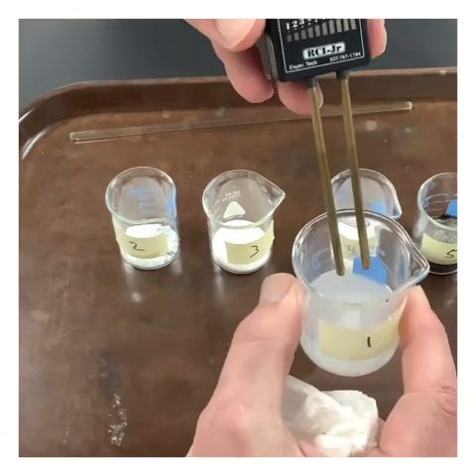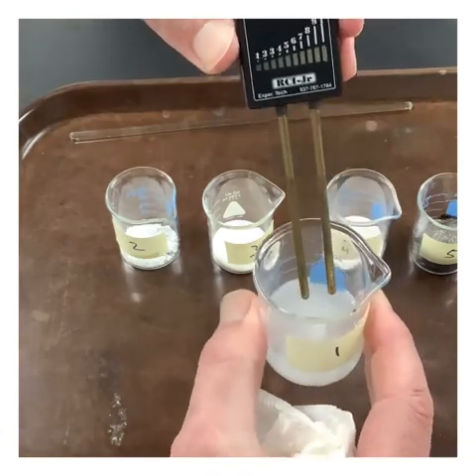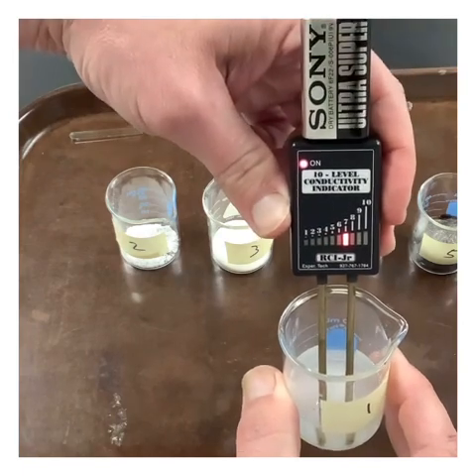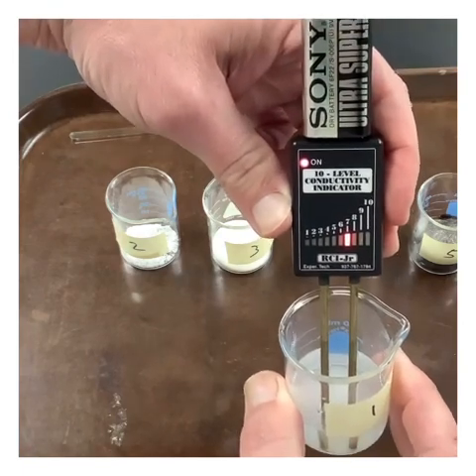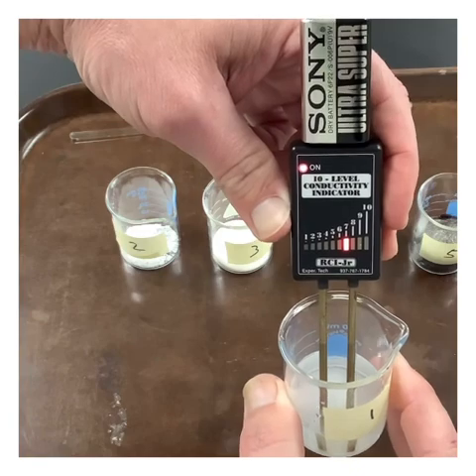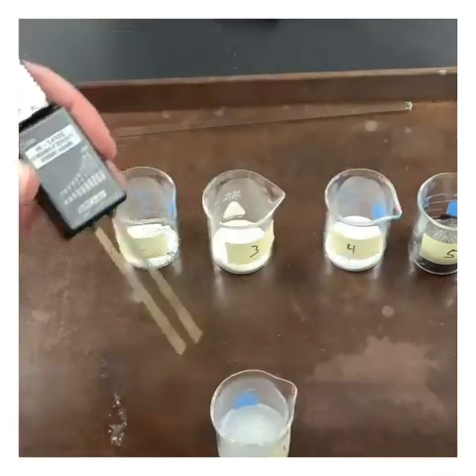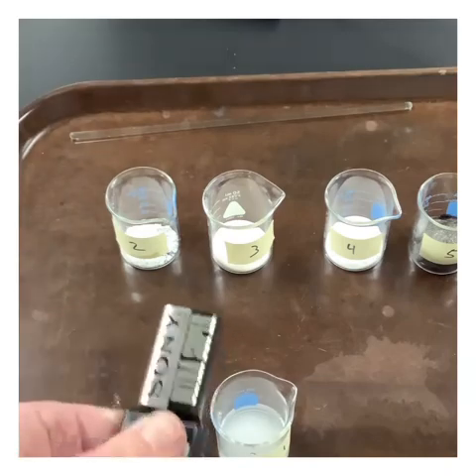Let's go ahead and test number 1's conductivity when it's dissolved in liquid, in water. So we push it in here. Looks like we're conducting quite nicely once we dissolve it in water. Okay, there's our first one.